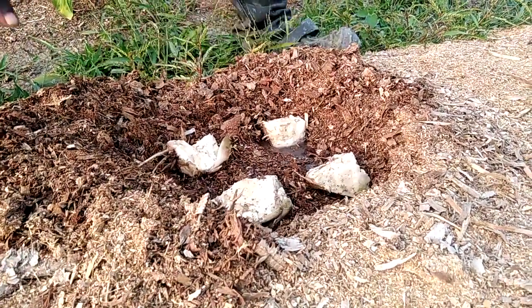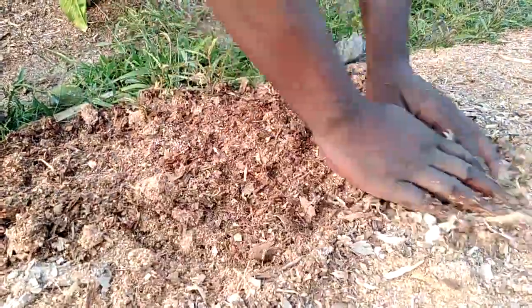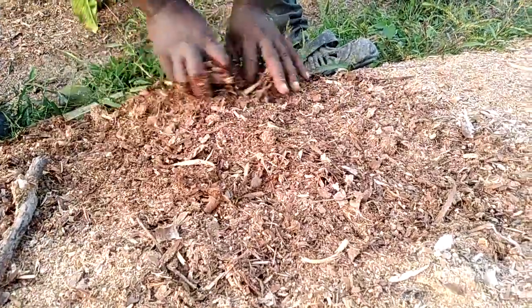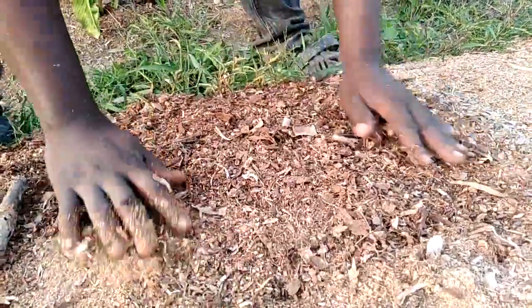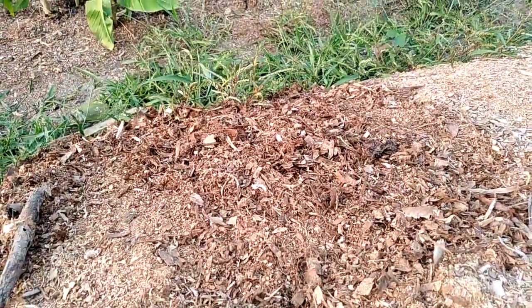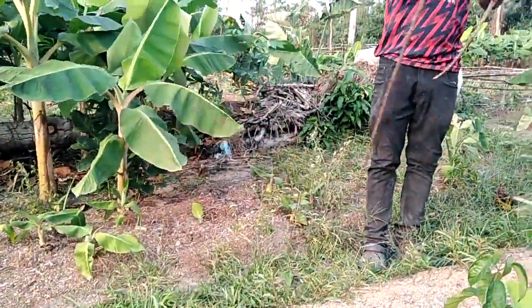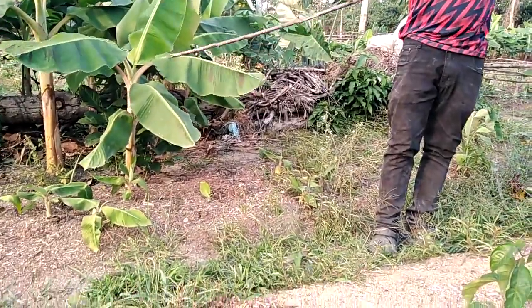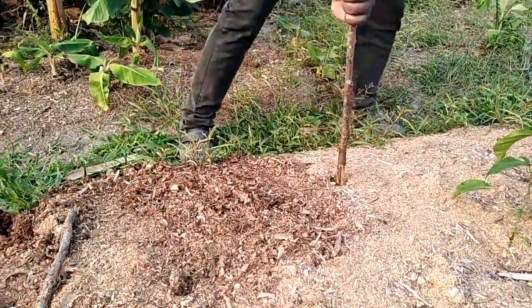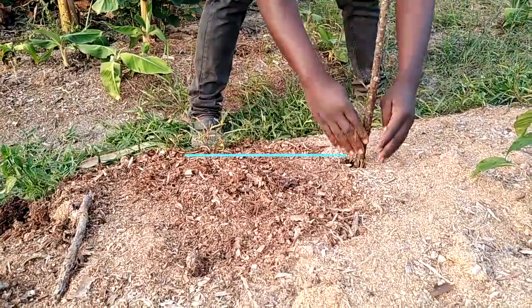From there, they will be covered with a substrate. Then we identify them. This is a mode of identification for these practicals.